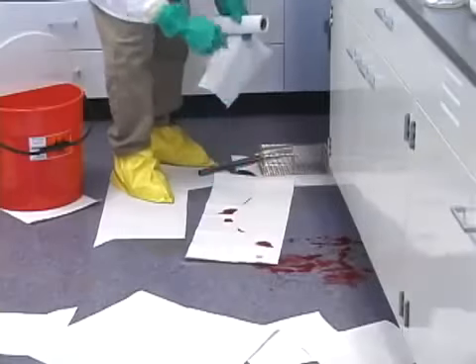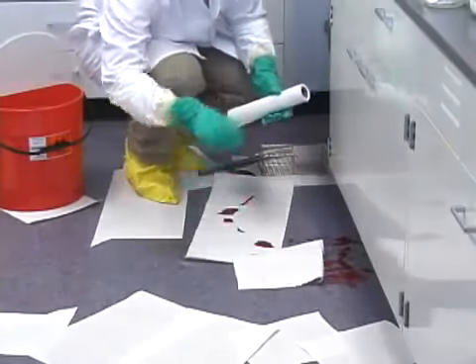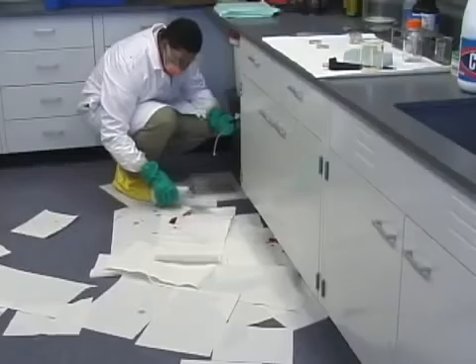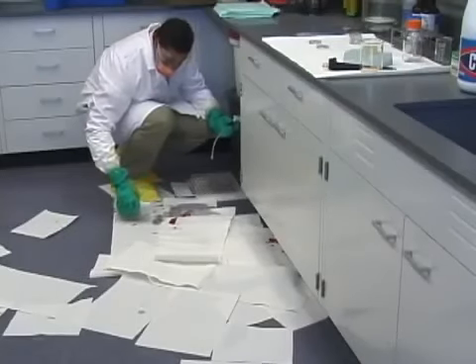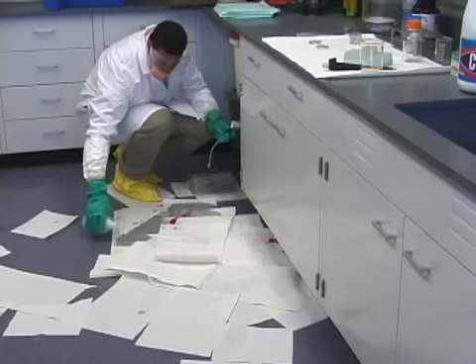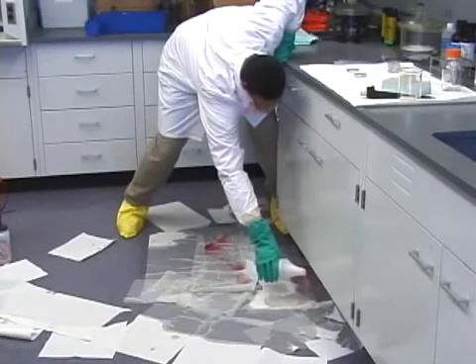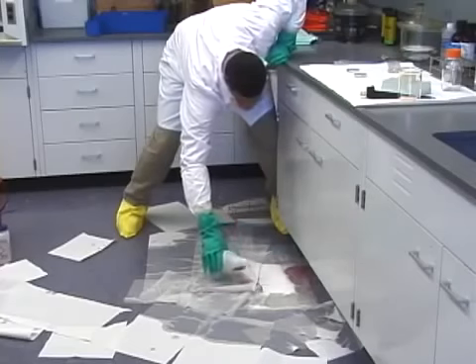Next, place absorbent materials on top of the spill and add disinfectant, usually a 10-to-1 dilution of freshly prepared bleach solution, first around the edges and then in the middle of the spill. The disinfectant must remain in contact with the spilled material for at least 15 minutes.